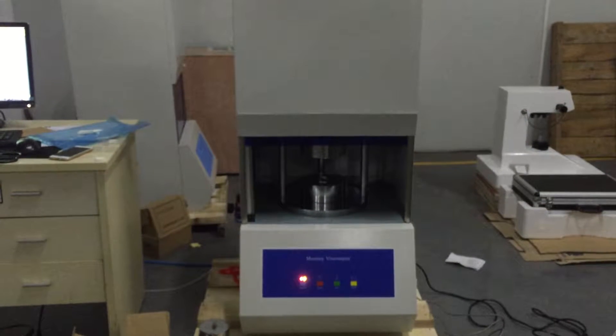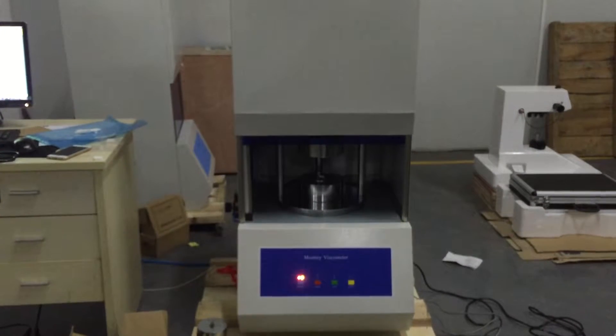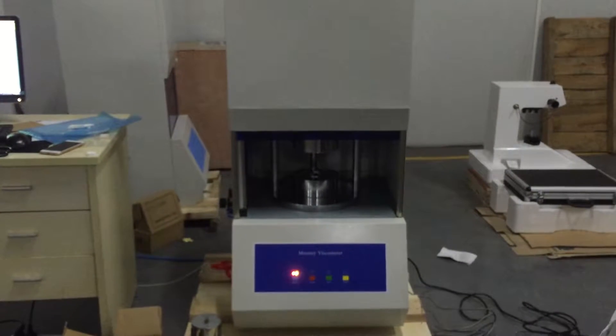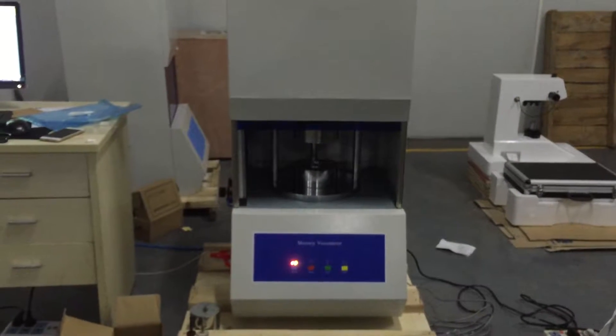This is our computer control Mooney viscometer. Today, we will introduce the machine structure and how to use the machine.